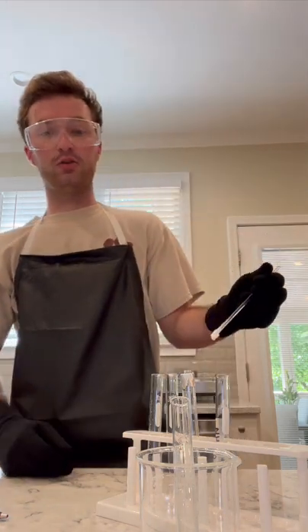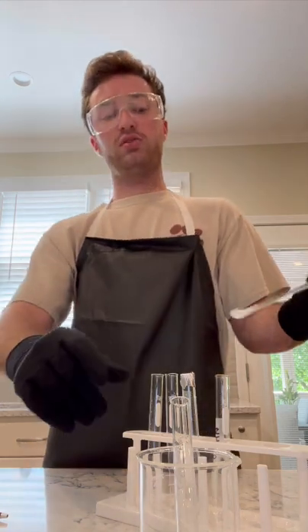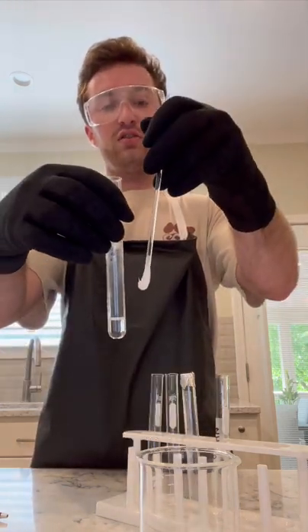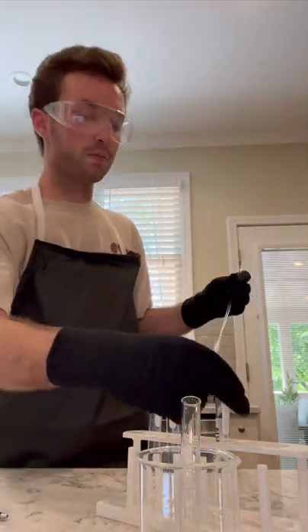I'm going to stick this into the NH4OH, kind of wet up the filter paper, so to speak, and I'm going to take that and just kind of hover it above the HCl, and just record and talk about the observations as it goes on. So I'm going to go ahead and do that.